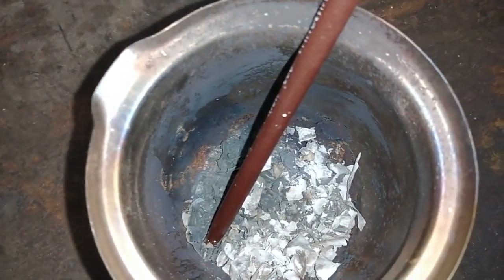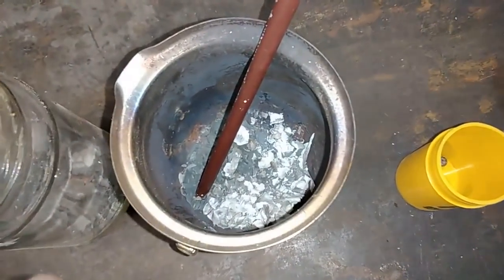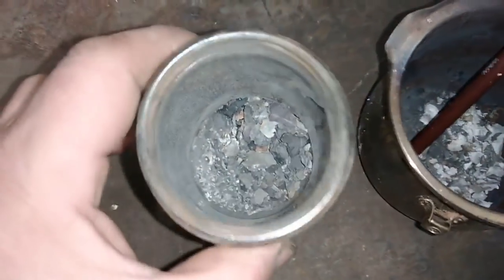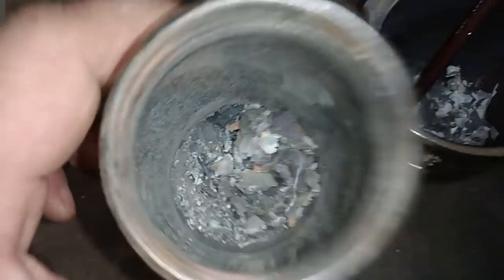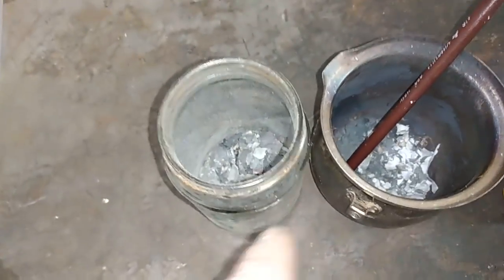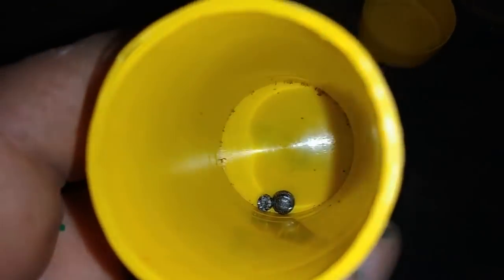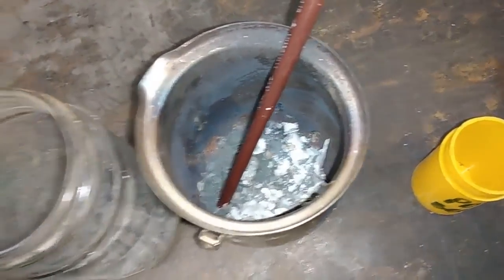It's not worth melting that small amount of palladium here. To show you exactly what I do — I collect a small amount of palladium like this in this cup and add it to the jar. In this jar I got some palladium powder, burnt filters from a stockpot and some other stuff. So I collect that for a final refine because I don't want to refine a small amount of palladium. When I collect some palladium powder I just melt that into a dirty bead, then collect those beads and on the end do a final refining step.